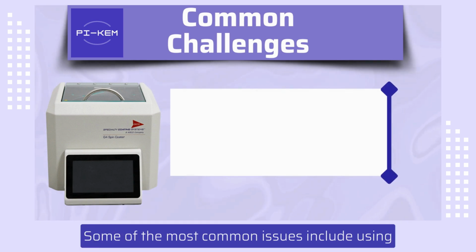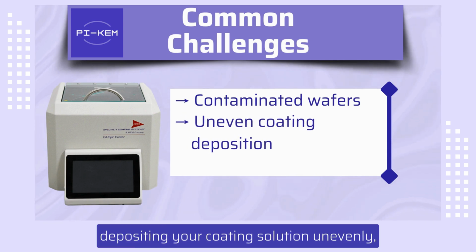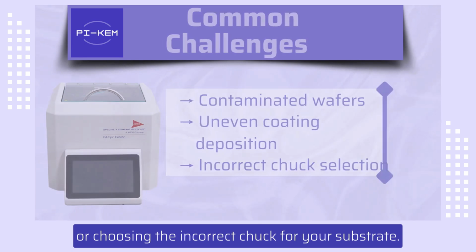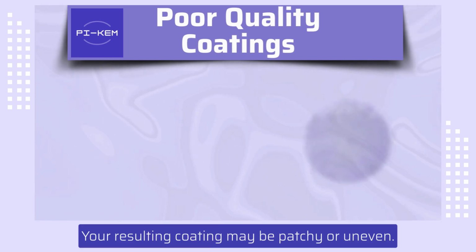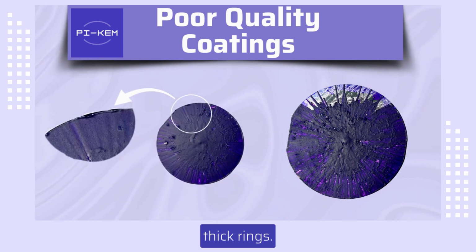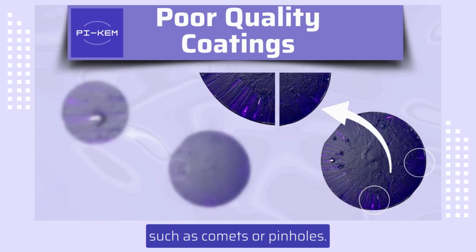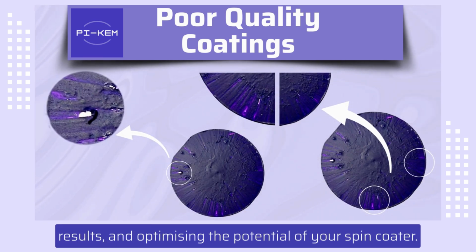Let's start by exploring some of the challenges you might face when spin coating for the first time. Some of the most common issues include using contaminated wafers, depositing your coating solution unevenly, or choosing the incorrect chuck for your substrate. These mistakes can manifest themselves in several ways. Your resulting coating may be patchy or uneven. Your substrate might demonstrate raised edges or thick rings. There may be the presence of surface phenomena, such as comets or pinholes. Identifying these problems is key to improving your results and optimizing the potential of your spin coater.